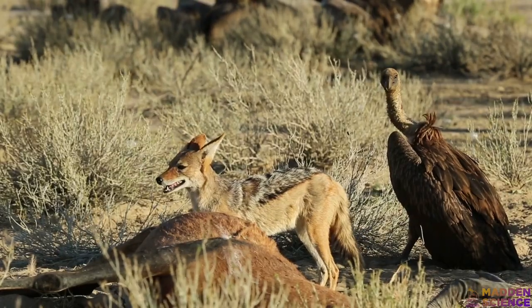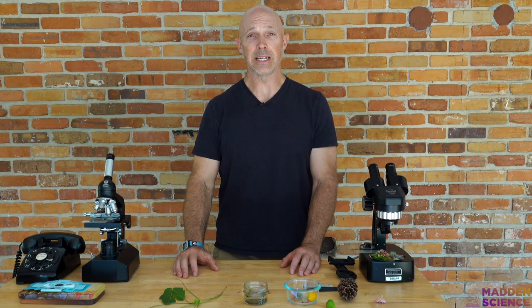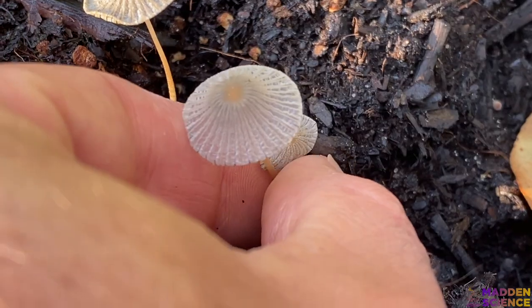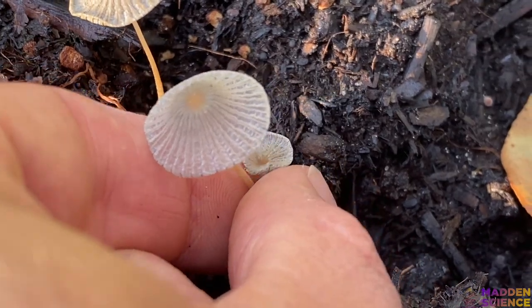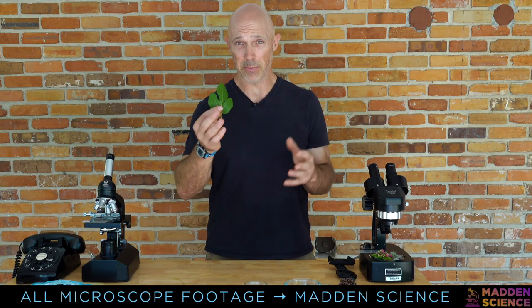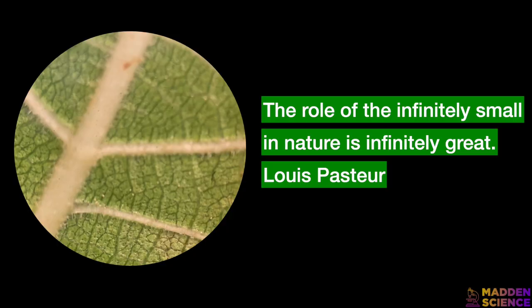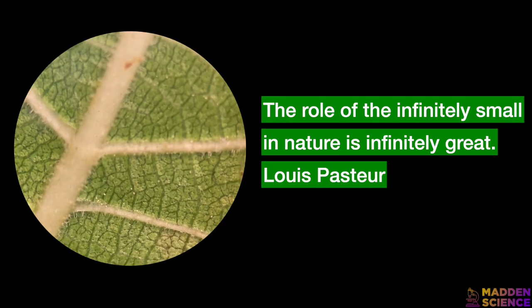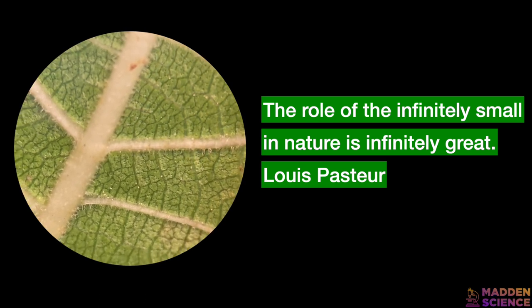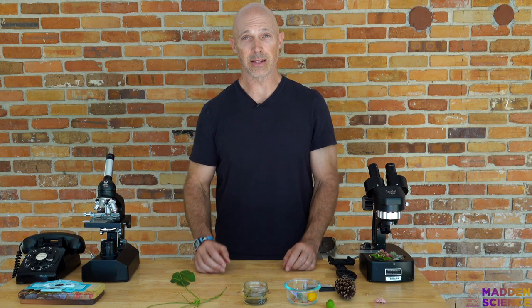We'll begin with the Scavenger Phase. To start, you'll need to get out into nature. Go find some cool stuff to look at. Use this as your guide — ask yourself, is this something rad to look at, and would it be even more rad to look at under the microscope? If the answer is yes, keep it. Let fun and curiosity guide you.